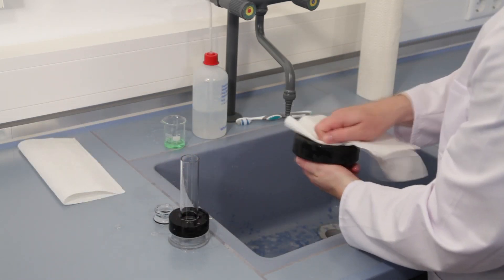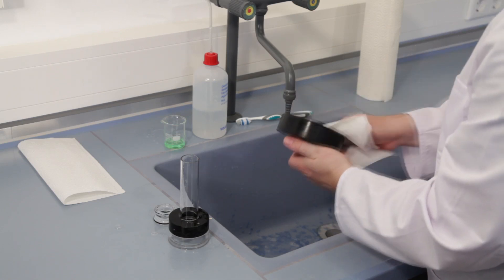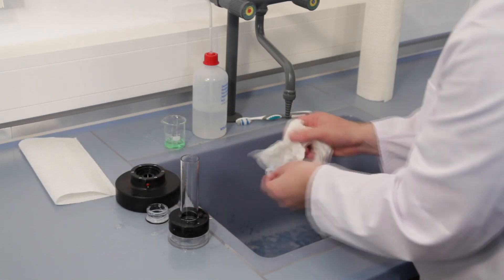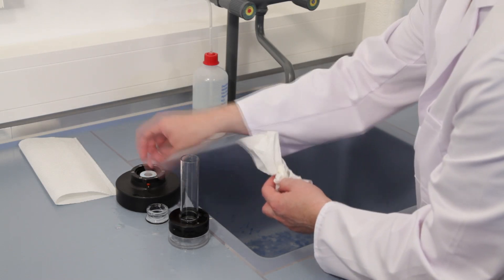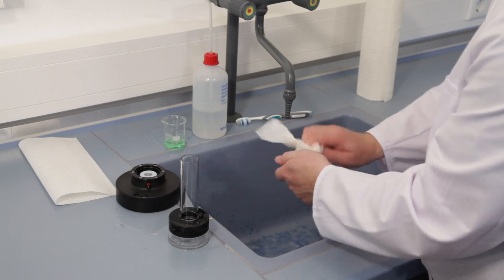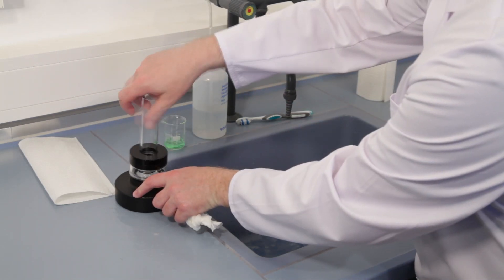Finally, dry all parts with a towel and reassemble the measuring cell.